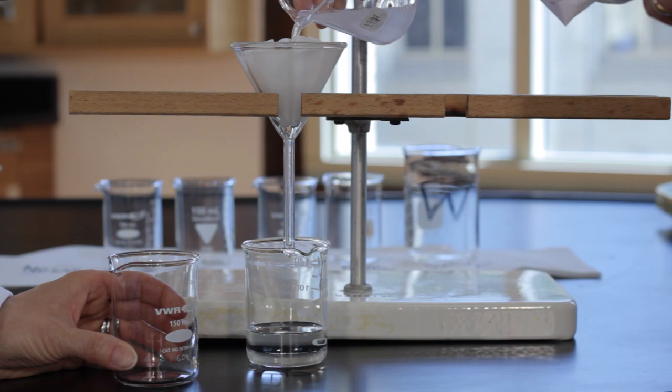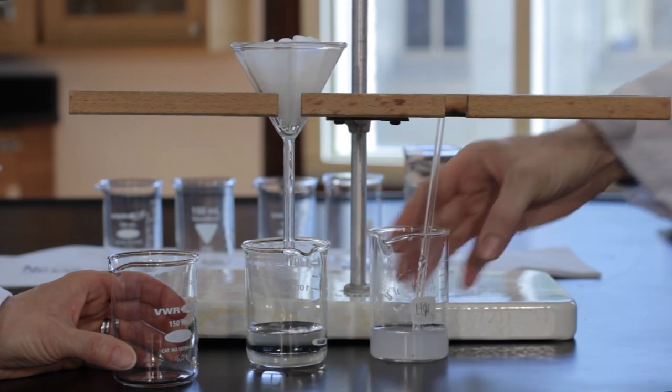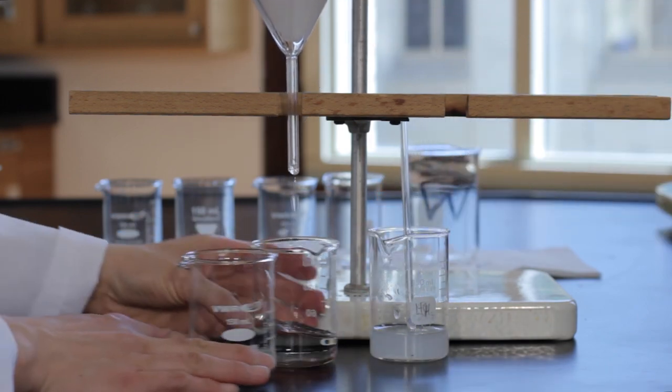Pour some of the filtrate, which is the filtered solution, into another dry beaker. This beaker is referred to as the secondary beaker.